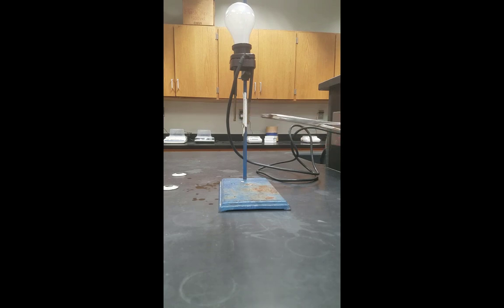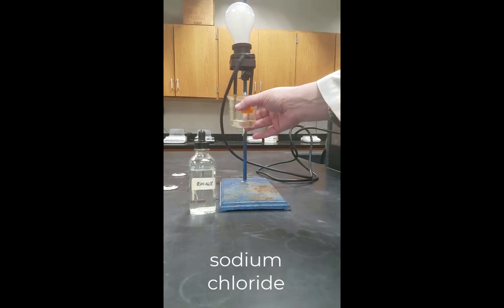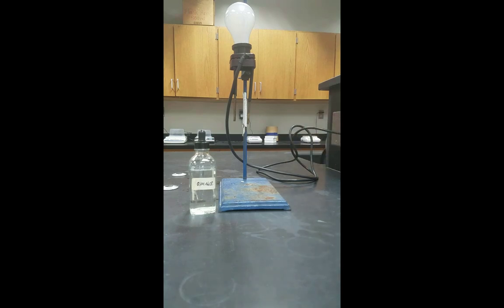There are the electrodes. Notice I'm not touching those electrodes with those metal tongs, or I might be dead after the process, because those are very much live. All right, so the first solution I'm going to look at here is sodium chloride. And you'll notice when I take sodium chloride and test it, the bulb glows very brightly.